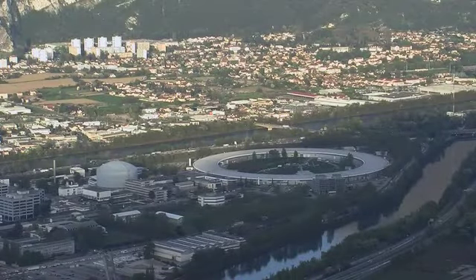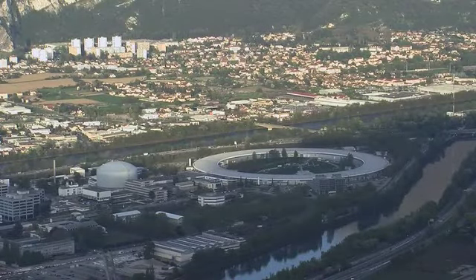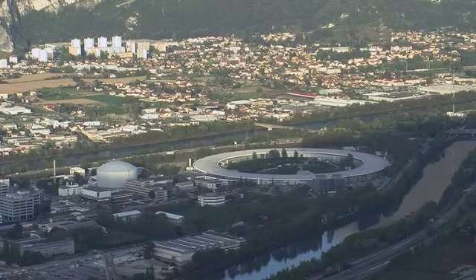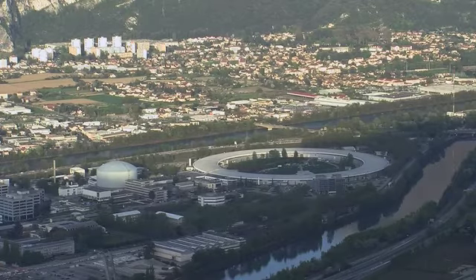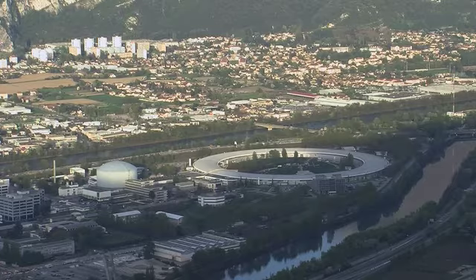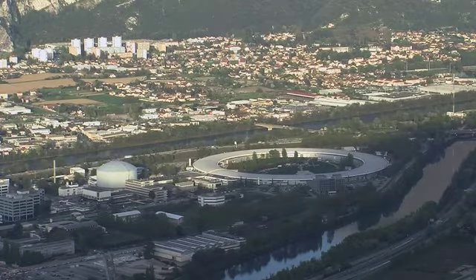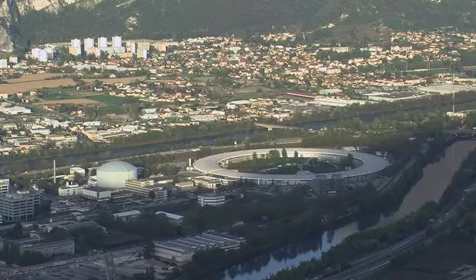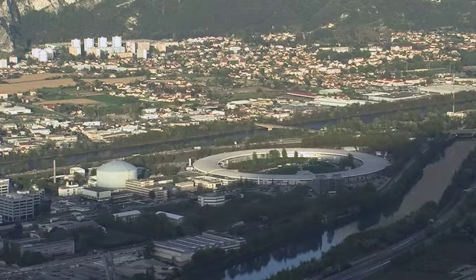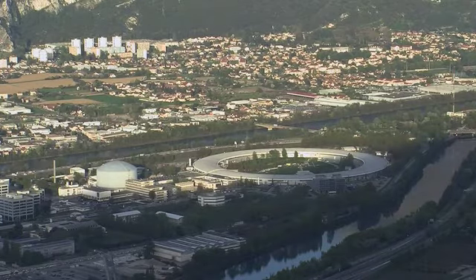What do you know about x-rays? We all know they are used to take pictures of your bones or to see the contents of your bag at the airport. But have you ever imagined that a very powerful source of x-rays could also help solve industrial problems and could help speed up your innovation process? Well, yes it can, and the ESRF does it.